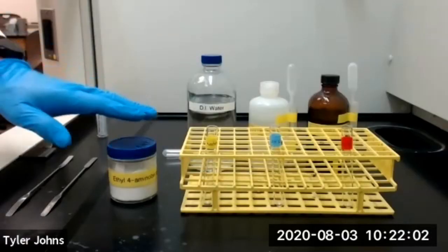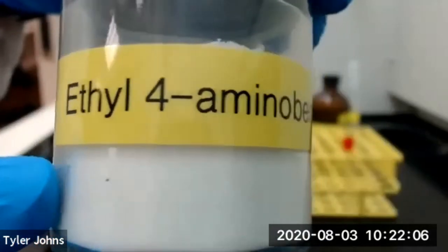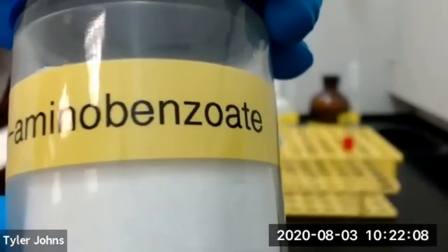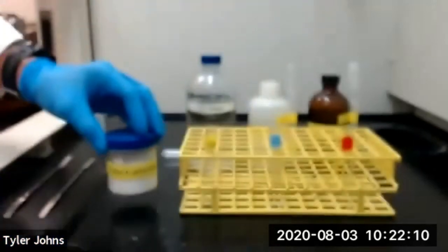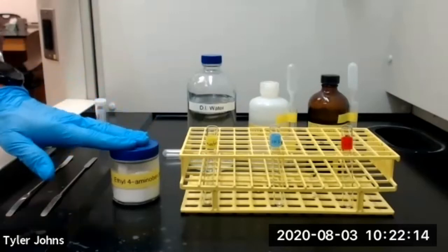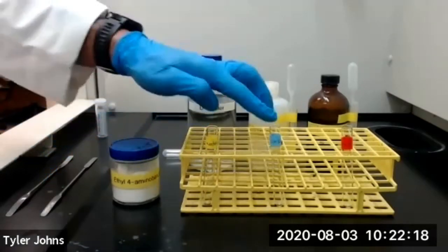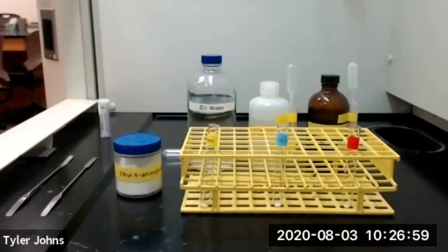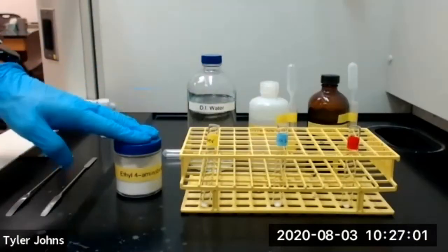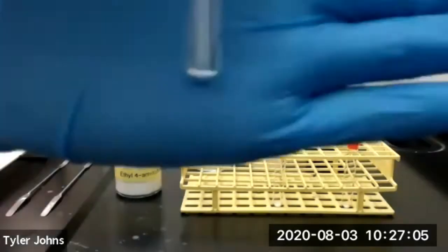We're next going to repeat this procedure, but use ethyl 4-aminobenzoate as our solid compound instead of the benzoic acid. So we first need to measure out 30 milligrams of ethyl 4-aminobenzoate into 3 separate test tubes. I've added 30 milligrams of ethyl 4-aminobenzoate to each of our 3 test tubes.